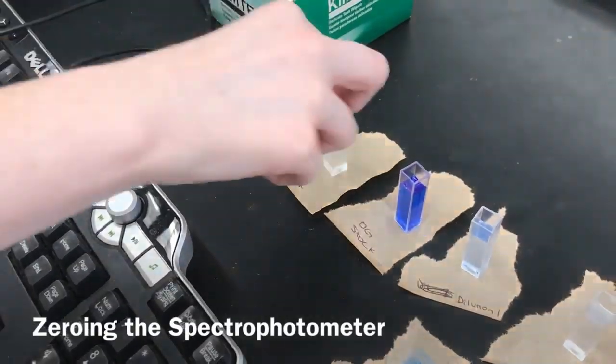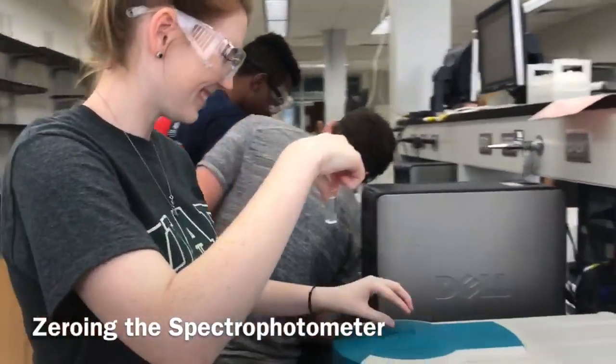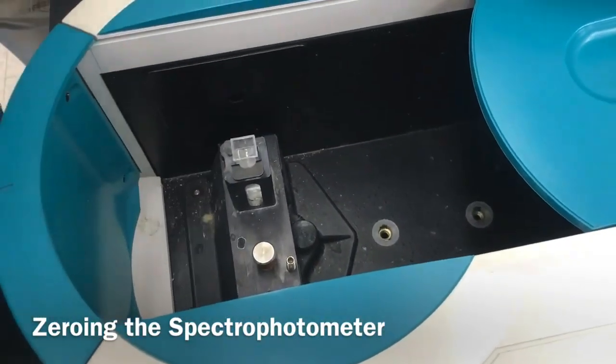Here we are properly zeroing our spectrophotometer by wiping the sides of our blank cuvette clean, placing the cuvette in the spectrophotometer with the clean sides in the beam, properly shutting the spectrophotometer, and then hitting reads and 0 on our program.